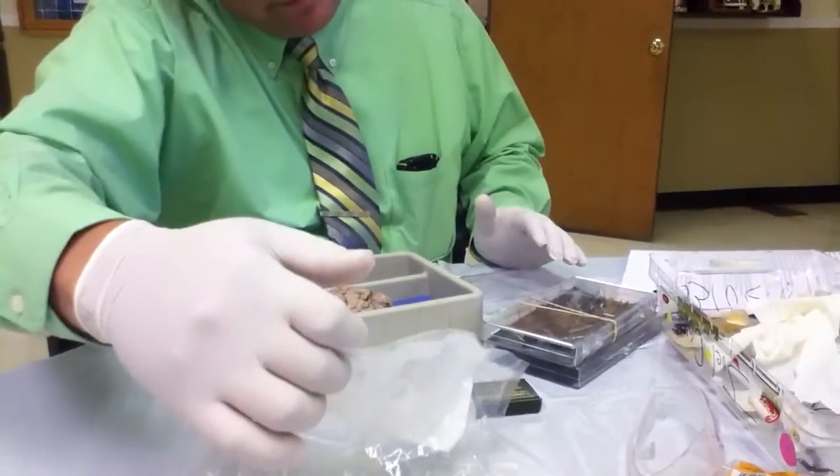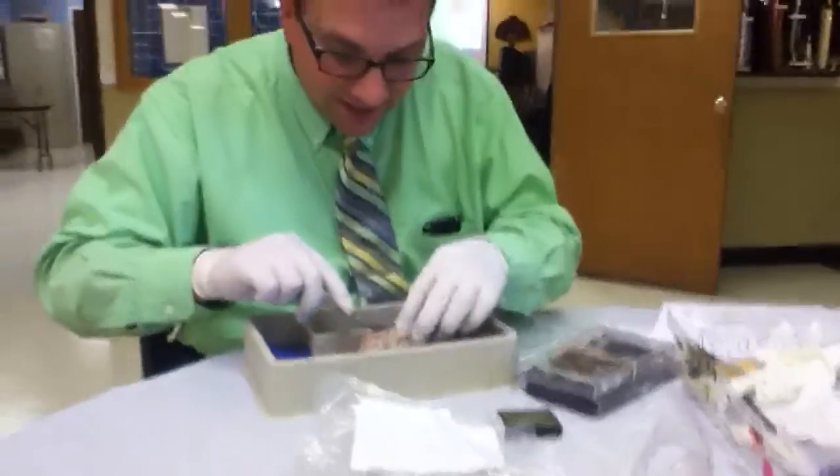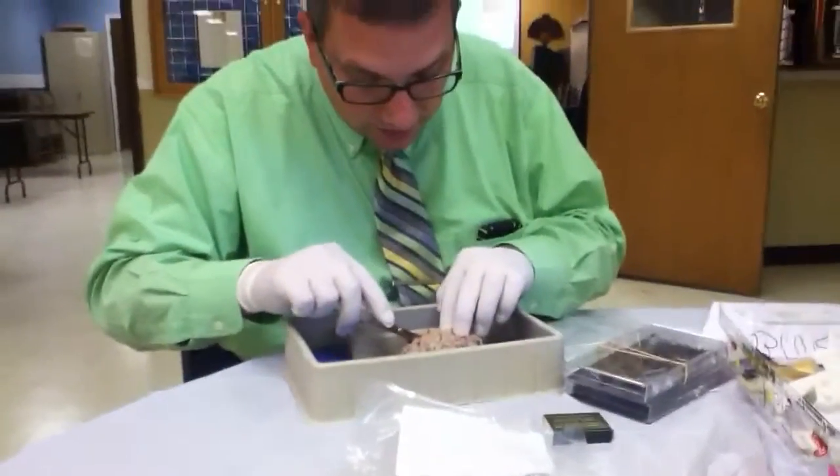You have more than one brain? We all have a brain. Ingestion — if swallowed, do not induce vomiting. Beautiful. I like how I told you not to eat the brain. So there's no meninges on this, so there would be a protective layer, but it's not there.